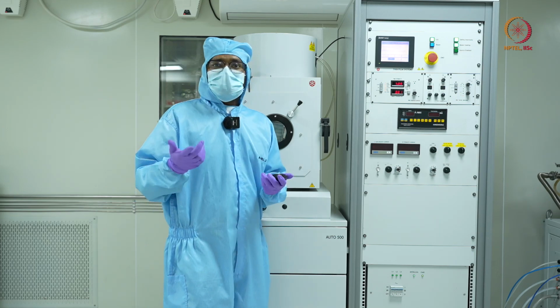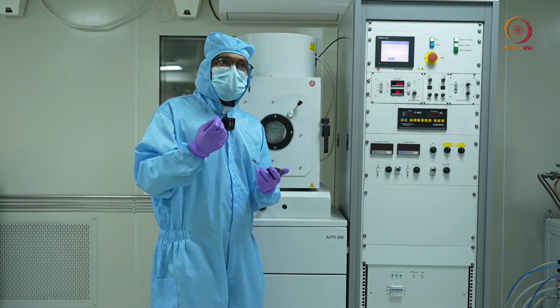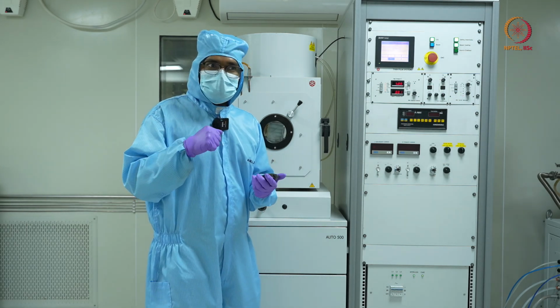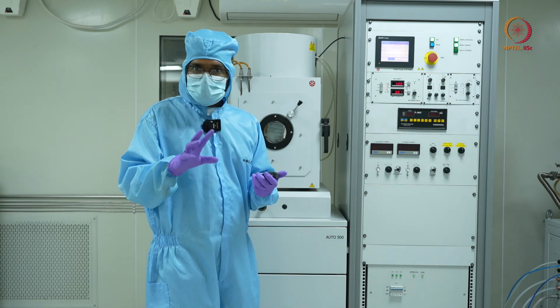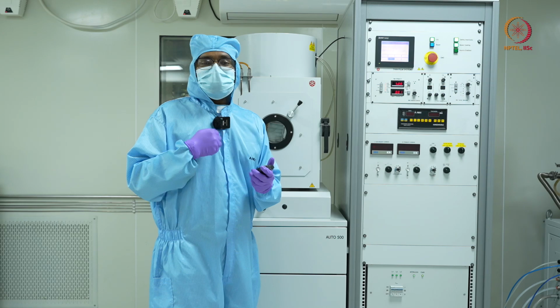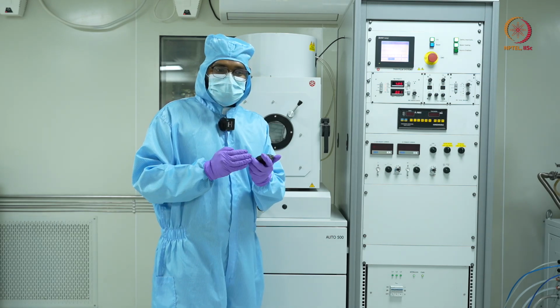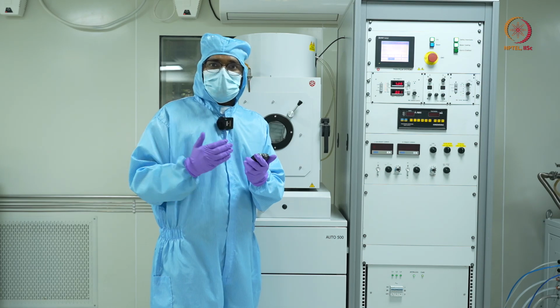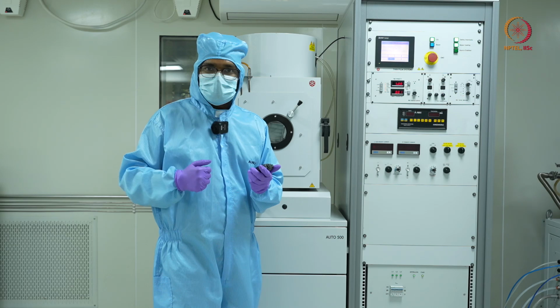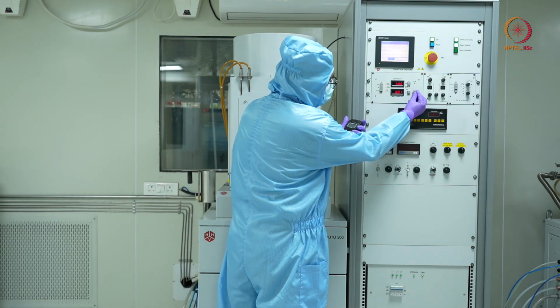The SOP says that we cannot heat any material with a very large current because there will be a thermal shock. The deposition, as we know, takes place at around 35 milliamps at a voltage of 5 kV. We cannot give 35 milliamps in one go. So in steps of 30 seconds and 1 minute, we will go from 10 milliamps, 20 milliamps, 30 milliamps, and 35 milliamps. Let's get started. I'll increase the current first.